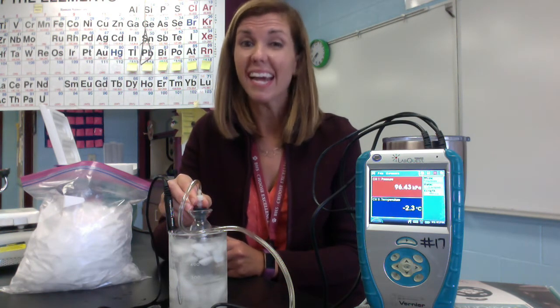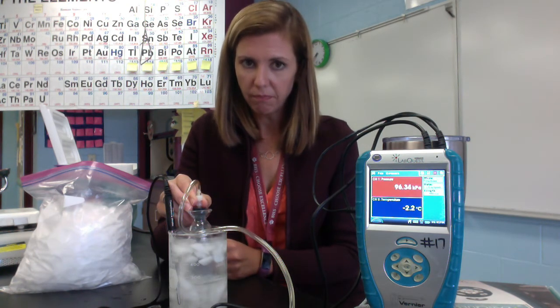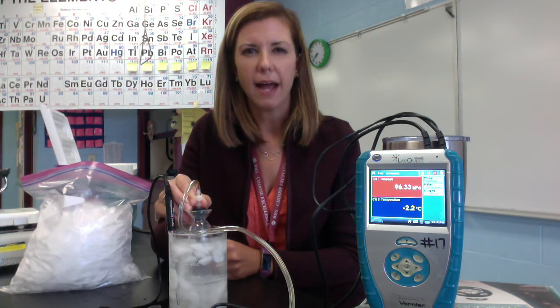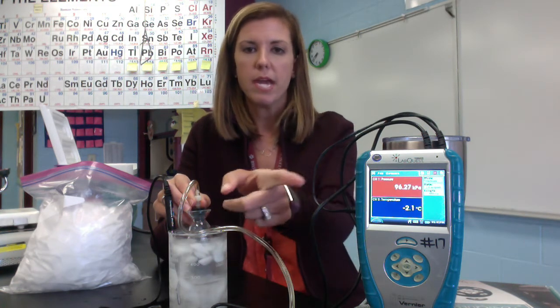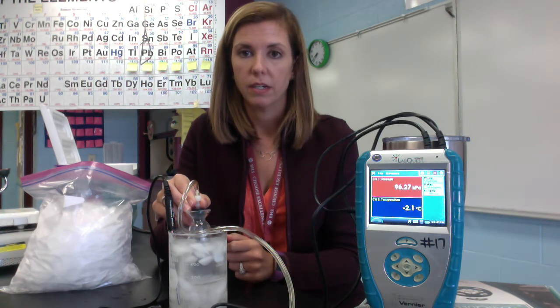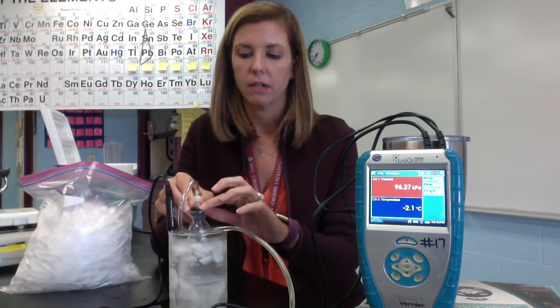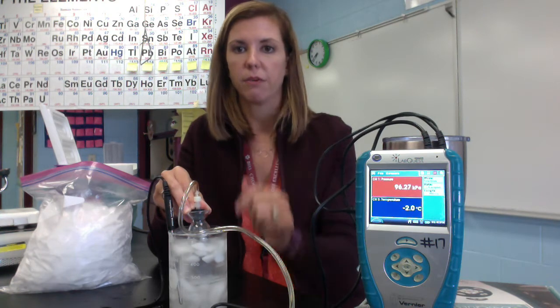As you can see, now we have a negative number in our degrees Celsius. So we've depressed the freezing point by adding that salt. And we'll talk in a later unit about why and how that happens. But for the time being, just know that we can make that temperature less than 0. And have the same, with a different pressure right there.